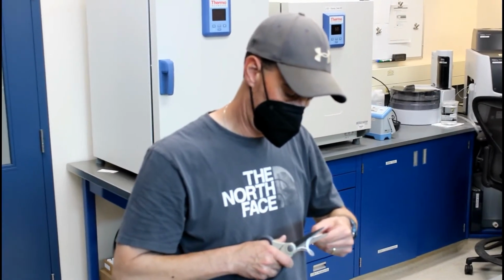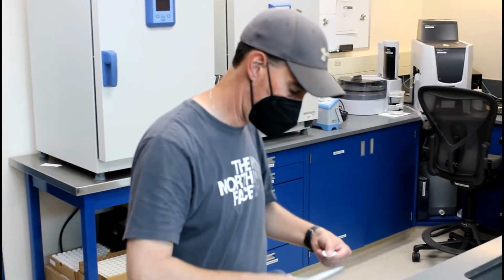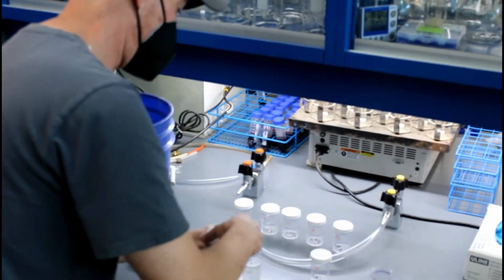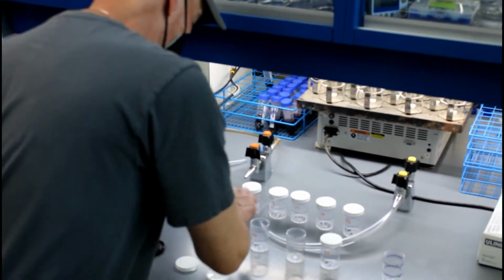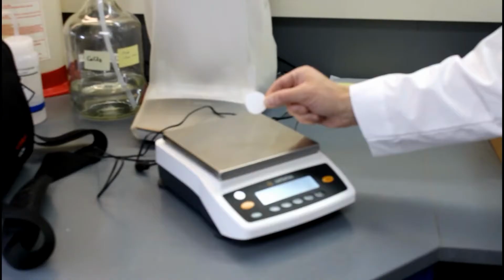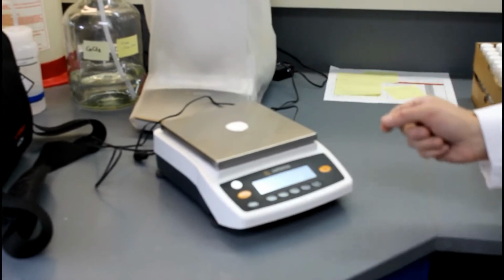A paper filter needs to be placed at the bottom of the microcosms to prevent the soil and the water from getting out of the microcosm cores through the holes below. That paper filter needs to be weighed dry and wet to know its exact weight with the empty microcosms, so later on we can assess and adjust the water concentration, the moisture content, in the microcosm cores.